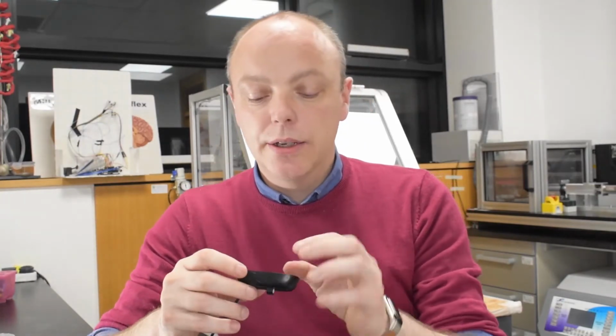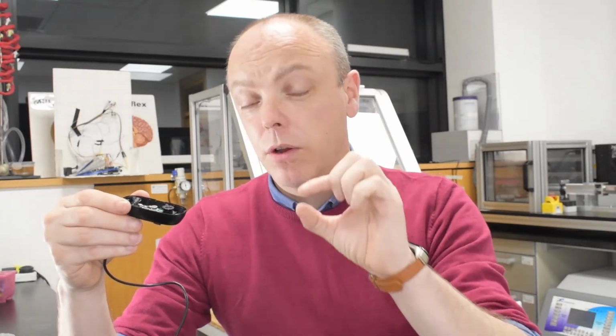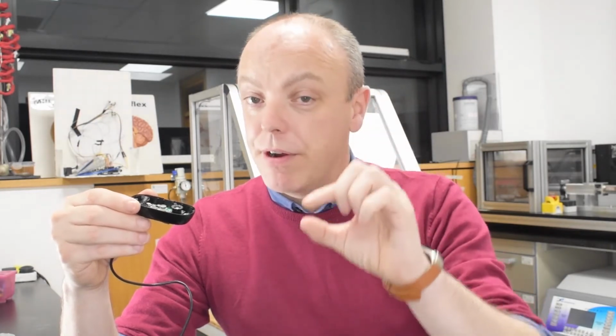But what this actually allows you to do is to move the lens further away from the sensor. And when you move the lens further away from the sensor, then if you're using it as normal, pointing it at your face, you'll be completely blurred. Because it's not focused on you, it's focused on something much, much closer. So the further away from the sensor you move the lens, the closer to the lens is going to be in focus. So we can use this to focus on something which is very, very close up. And if it's in focus and very close up, then it's hugely magnified. And that basically is what a microscope is.